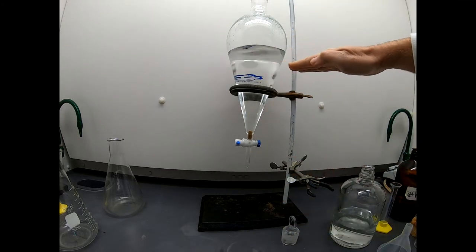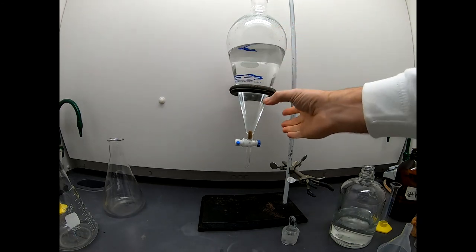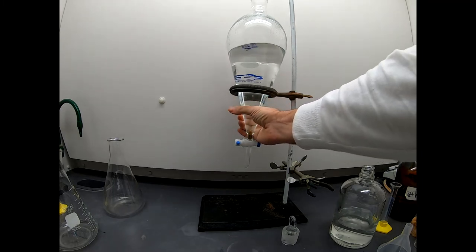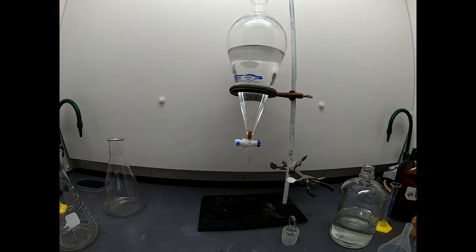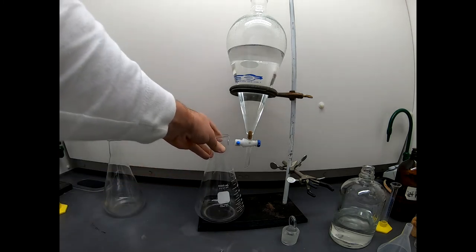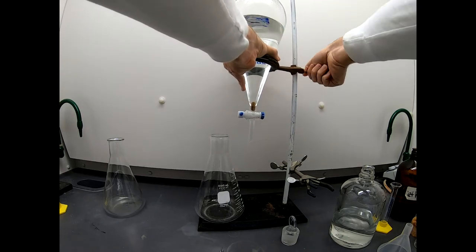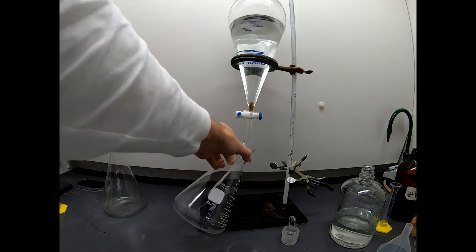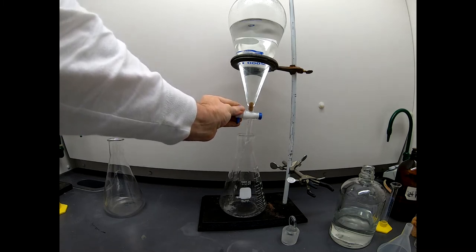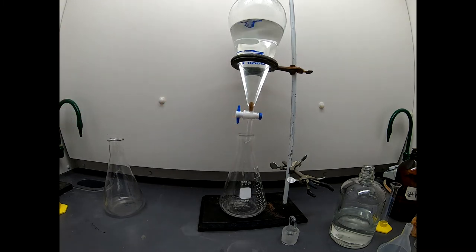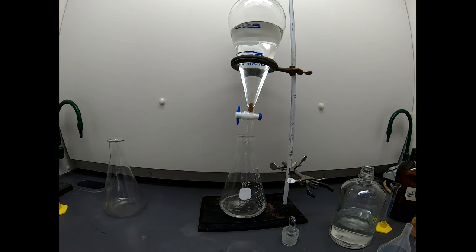Okay, that looks great. Now let's see how that looks. I don't know if you can see, but there are two layers. The layers are pretty clear, so it's not terribly obvious, but there is a division right there. This is a lot of aqueous layer on the bottom. Hopefully that contains most of our DMF. And on the top is the ether layer, hopefully containing our product. So now I need to fit this receiver flask on the bottom. I might lose the top of the sep funnel from the camera, but that's okay. There's not much to see there. I'm going to let this drain down. And this would go a whole lot faster if it weren't for that crazy stir bar getting in the way, but that's okay. We can outweigh that stir bar. And what I'm looking at is this line. That's our division line. Our phase change.